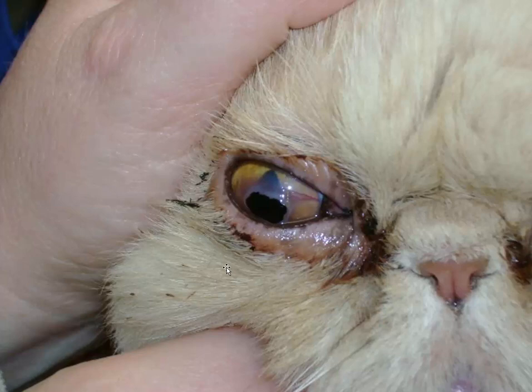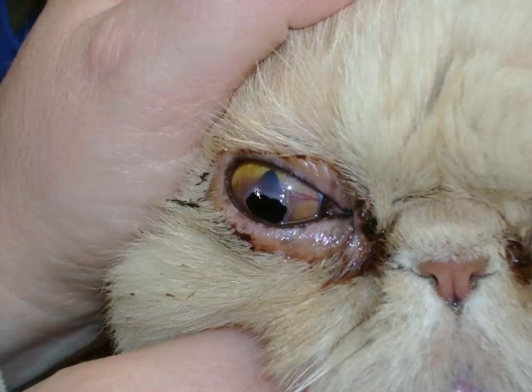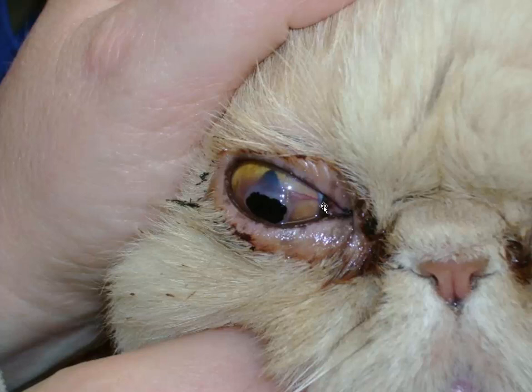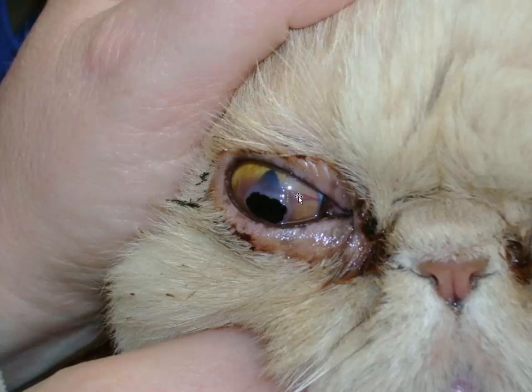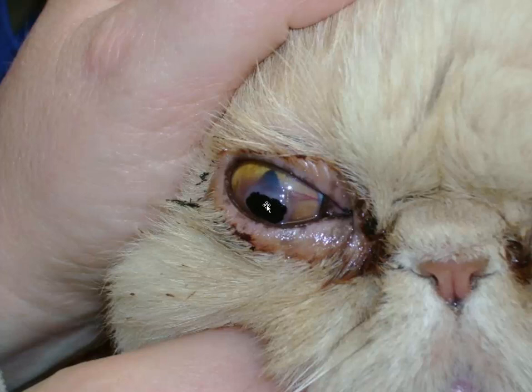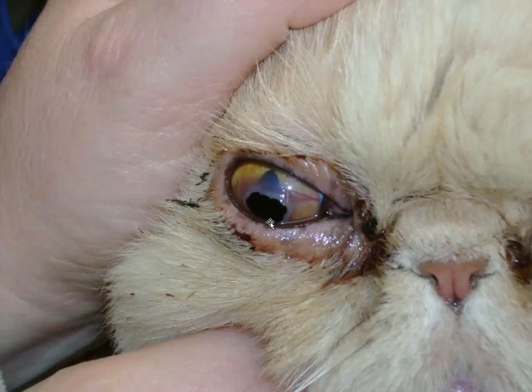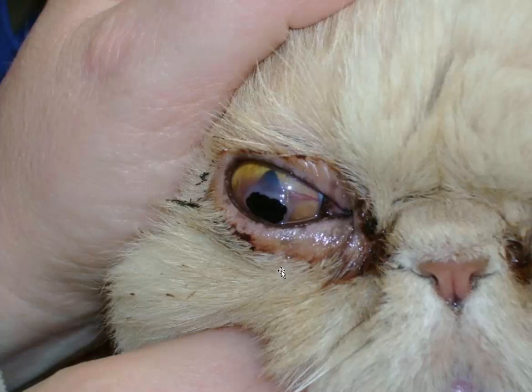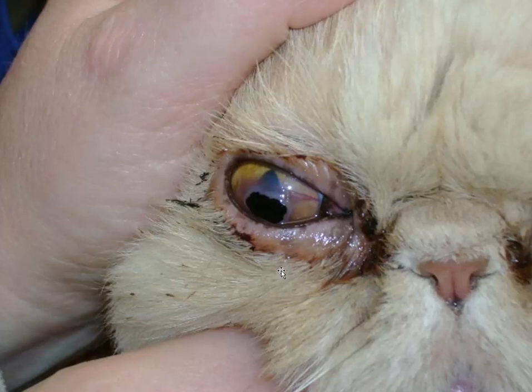There will probably be a scar there. The cause may be focal corneal drying in the center of the cornea, which is usually where it's seen. You can see that there is some neovascularization, so this is a fairly long-standing lesion. Histologically, nothing except a little brownish discoloration of a fairly normal-looking cornea. So: corneal sequestrum or corneal mummification.